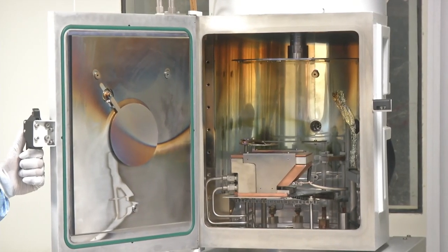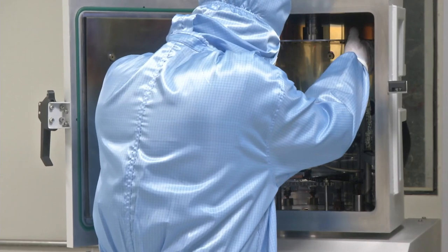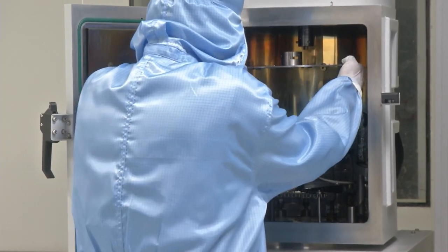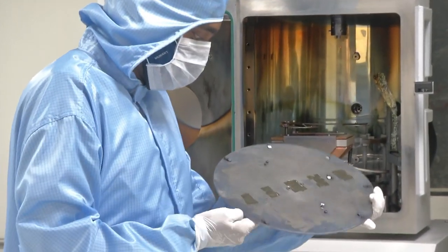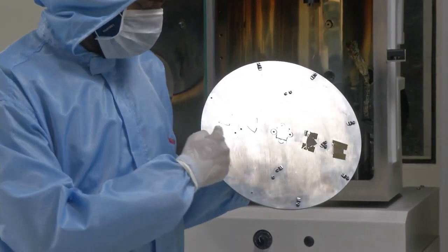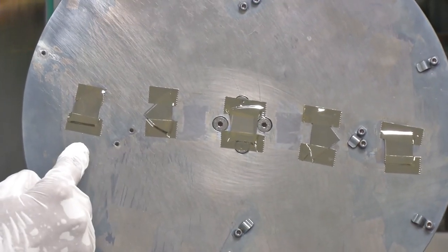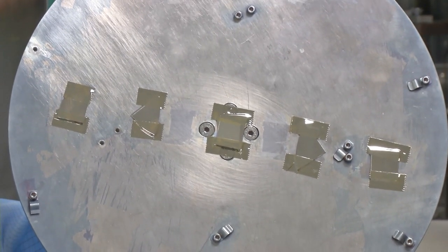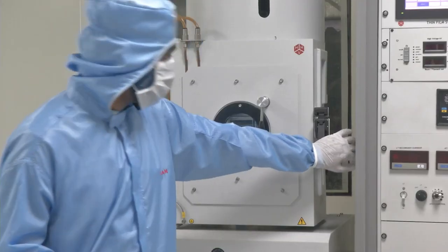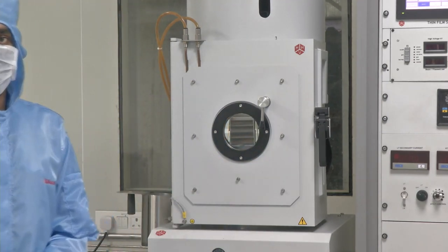Once the chamber is opened, the next step is to remove the chuck on which the substrates are loaded. The chuck is carefully removed, and we can see that the metal has been successfully deposited — the samples have a shiny surface, confirming that metal has been deposited using the process of electron beam evaporation. Once the chuck is taken out, we unload the substrates and keep the chuck back in the chamber.